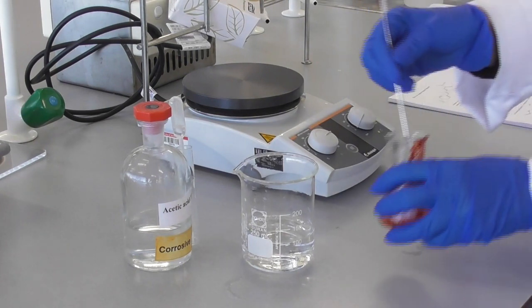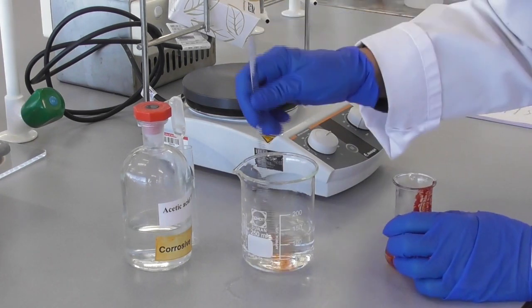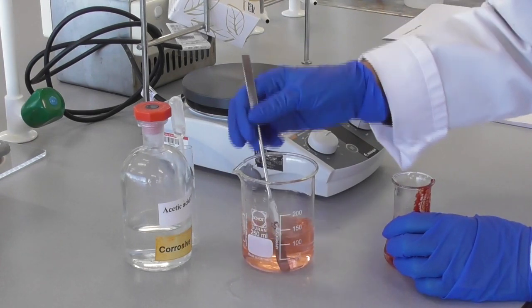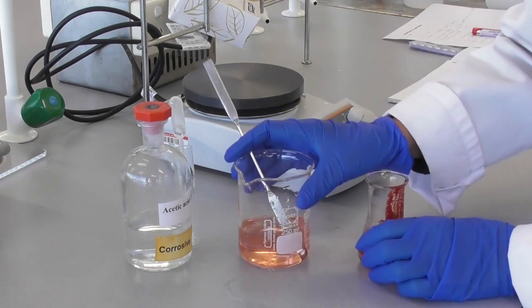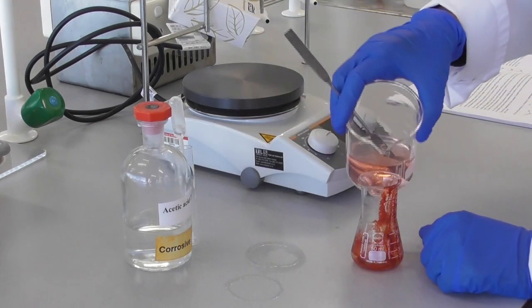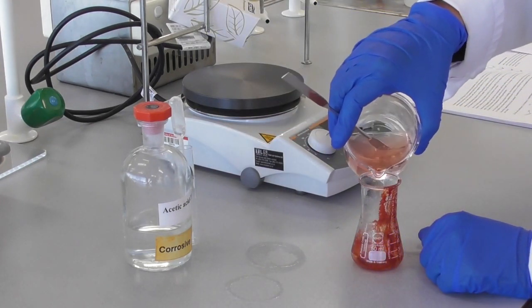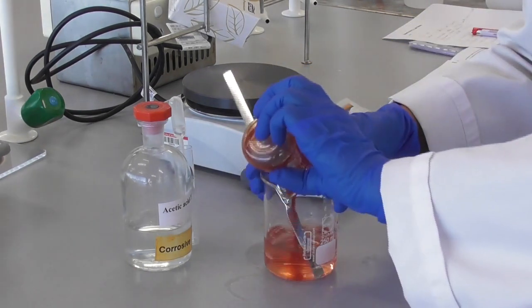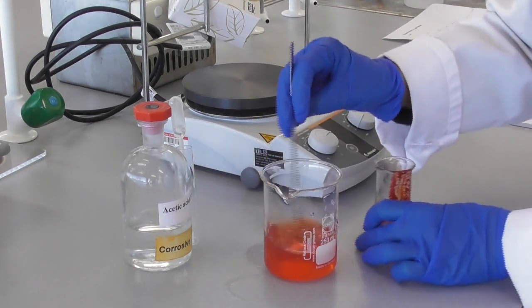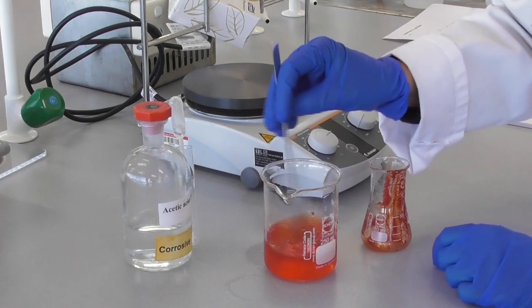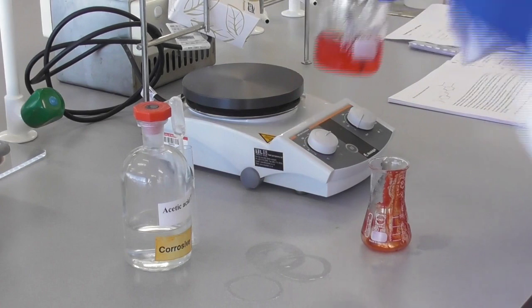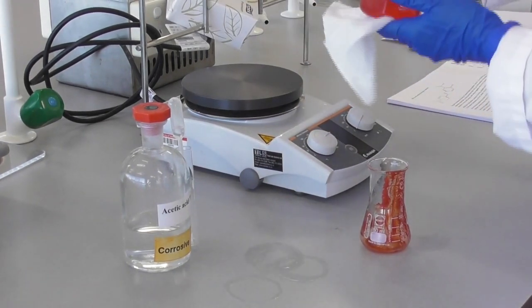And then we use the dye that is left on the equipment from the experiment, on the spatula and in the flask, to prepare a colored solution. We can pour some into the reaction flask and rinse it to get our dye solution which we can then heat up and use for dyeing different pieces of string.